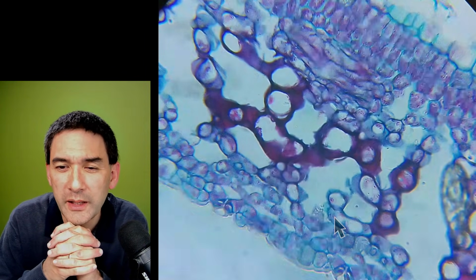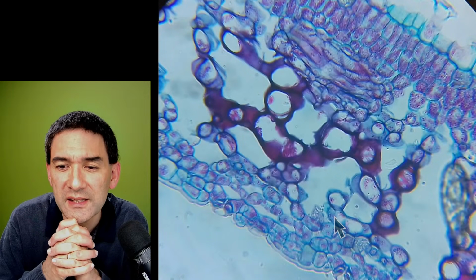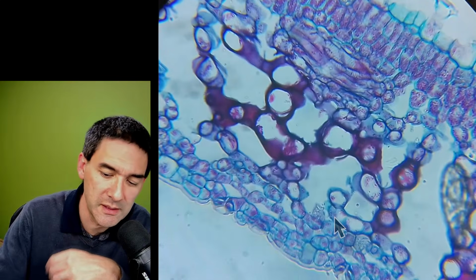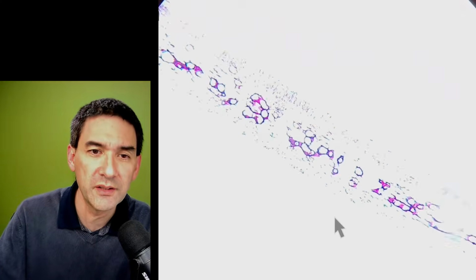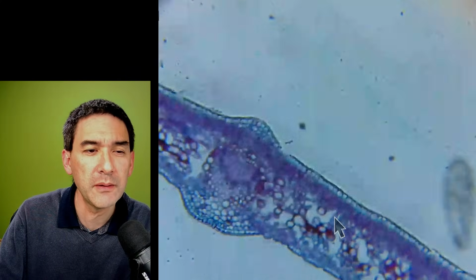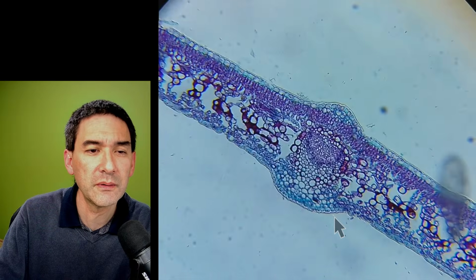How do we identify xylem from cross sections from the top view? From the side it's easy since it looks like a spiral. Oh, that's difficult. You have to look for the vascular bundles. Usually the xylem has thicker walls. I don't want to say anything wrong here.